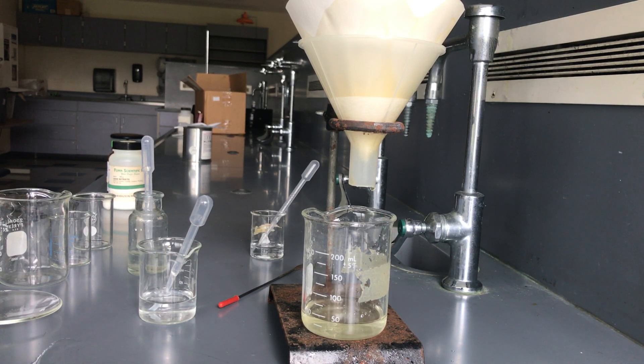So again, filtration is one of the main ways to separate and pull out solid components, especially in a precipitate that forms in a double replacement reaction like we saw in the previous video between lead nitrate and potassium iodide. So this has been Mr. Gardner. Hopefully you found something new and beneficial that you can use in your future chemistry classes. Take care.